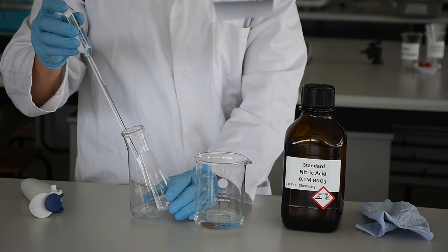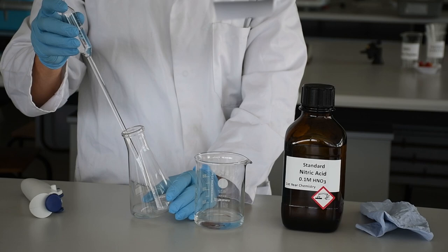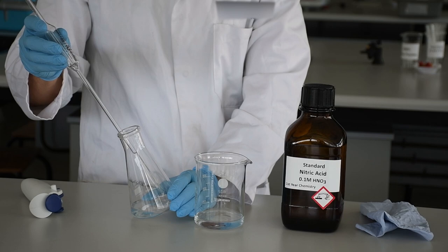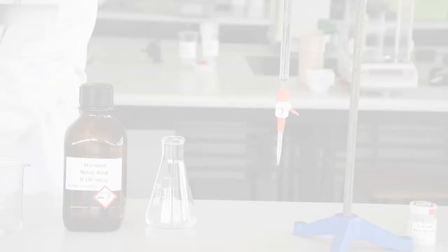It's also important to note that we never put our pipette into the communal bottle; we've poured our solution into a separate beaker. That's really bad lab etiquette because we risk contaminating the bottle for everybody else. If you're using something from a volumetric flask, pour it into a beaker first because it's quite difficult to pipette straight out of a volumetric flask.